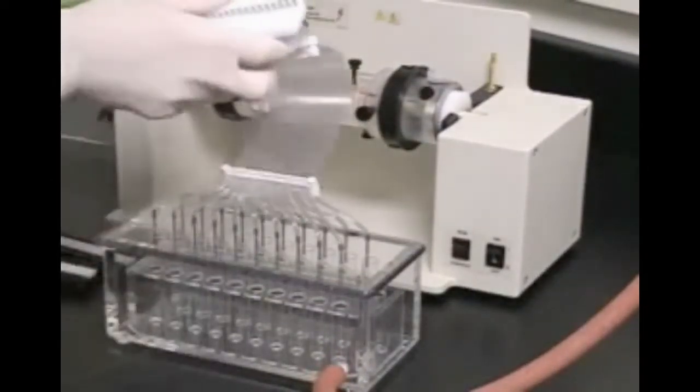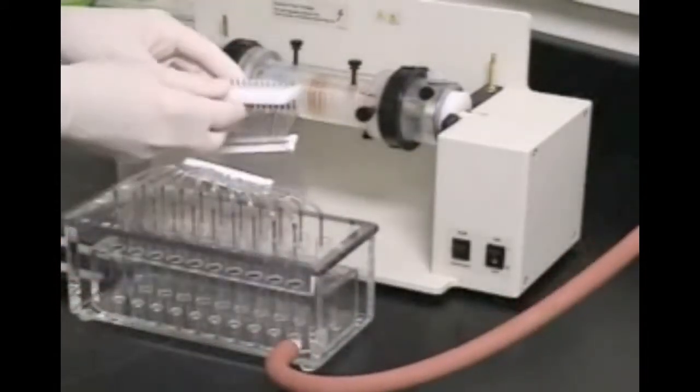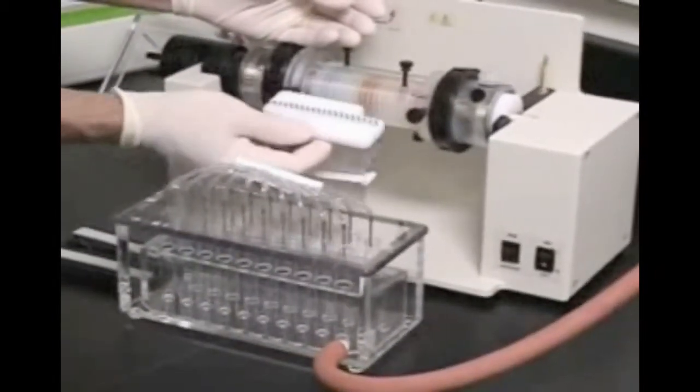Mount the needle array on the two alignment pins on the bottom of the chamber. Grasp the needle array with the fingers of both hands while placing your thumbs on the top of the focusing chamber.